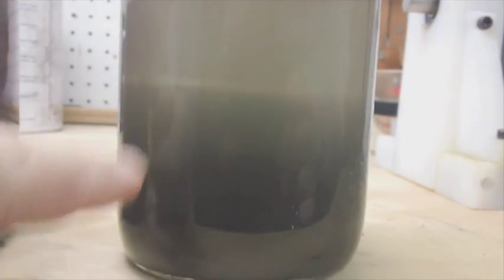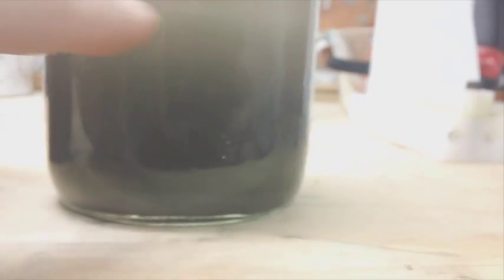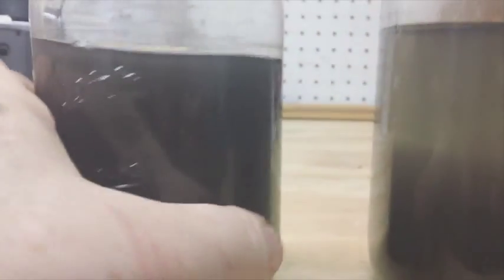It's sitting on top of the water, so this would be fine graphite or graphene, but I'm not sure of the quality of the graphene here. I'm sure the quality of the graphene up here is probably pretty good. So this is the mix from today I ran. You can see there's no distinction between it, it hasn't settled out.